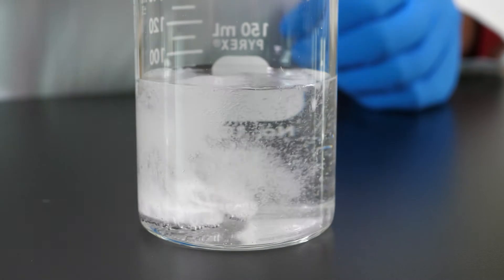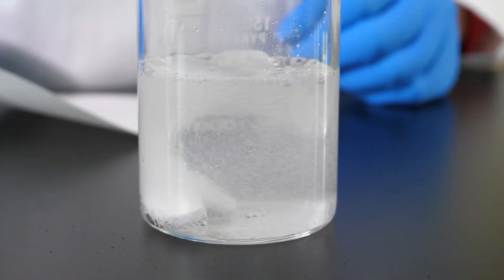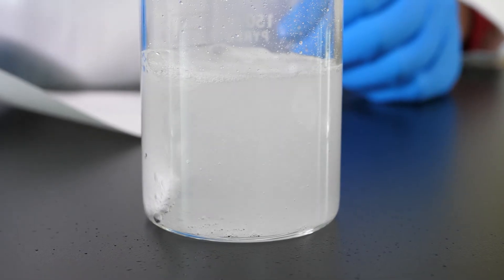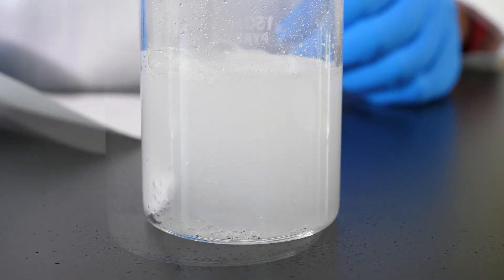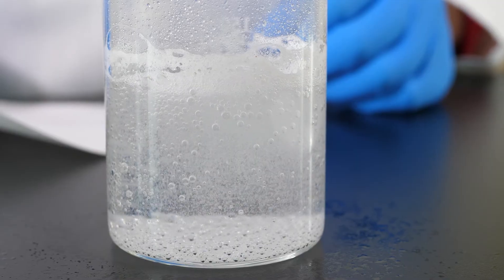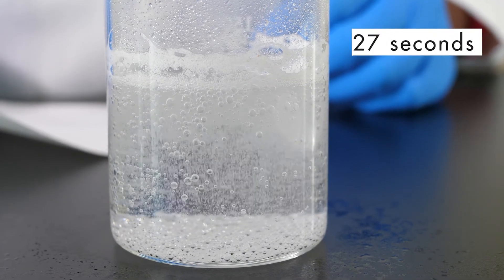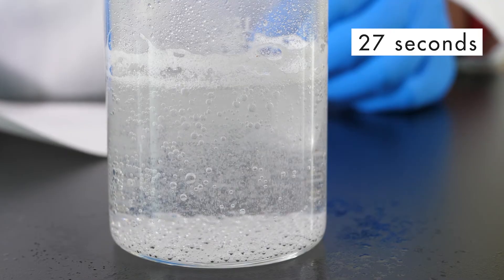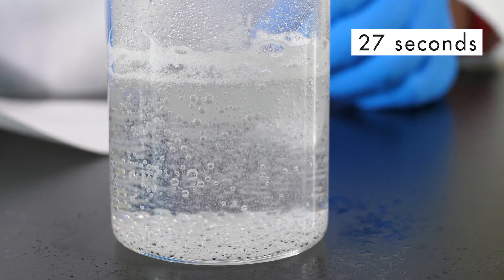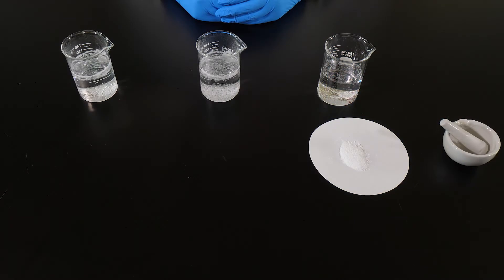We drop both pieces of the effervescent tablet into a beaker of warm water and time how long it takes the pieces to dissolve. We see that an effervescent tablet broken into two pieces dissolves in 27 seconds, slightly faster than the time it takes for a whole tablet to dissolve.